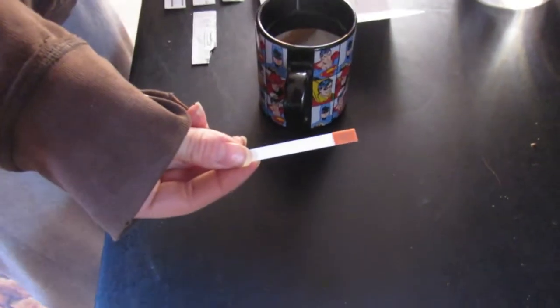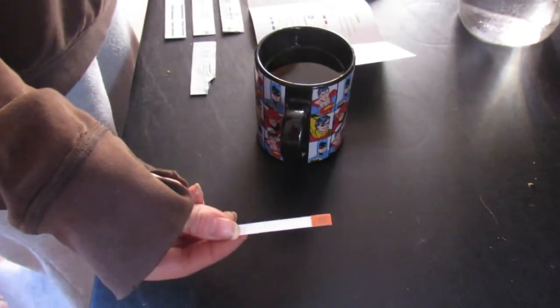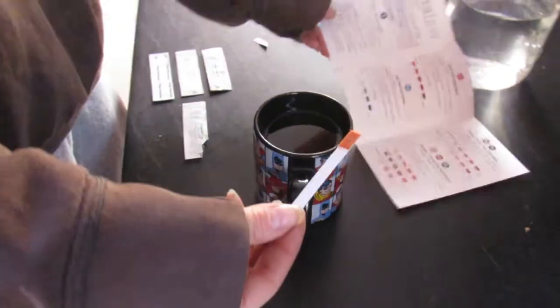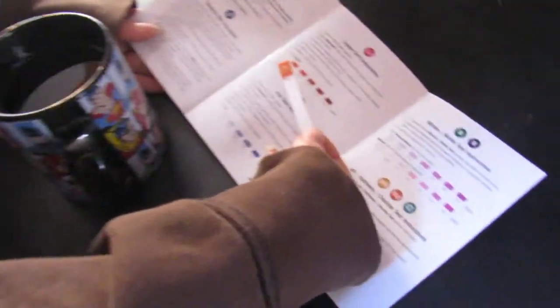Make sure you have a timer. I'm not sure how important it is, but it says to do it for two minutes, so that's what I'm doing.